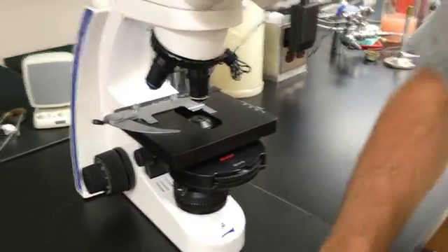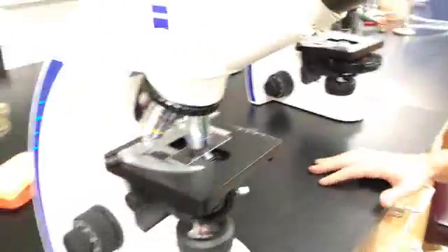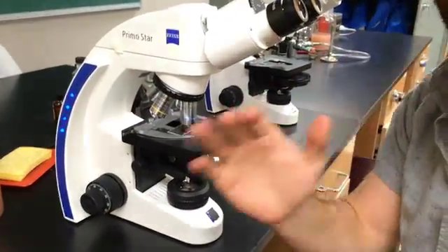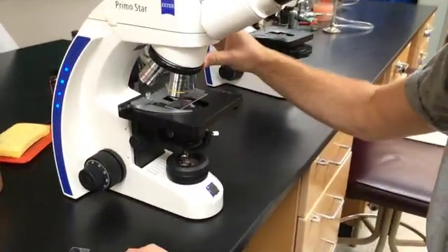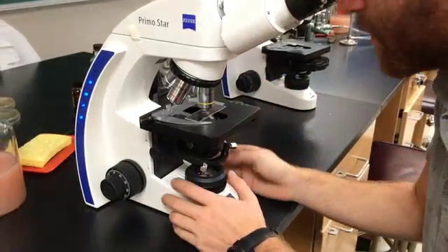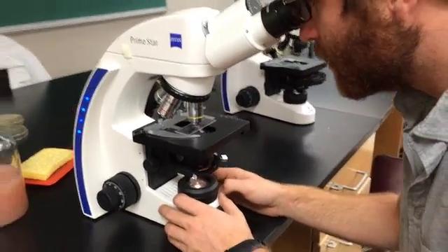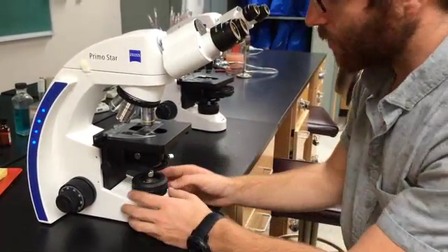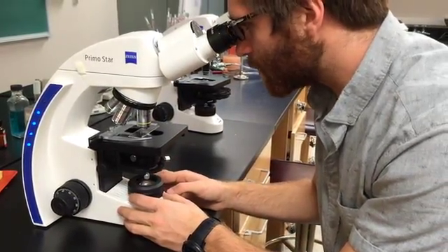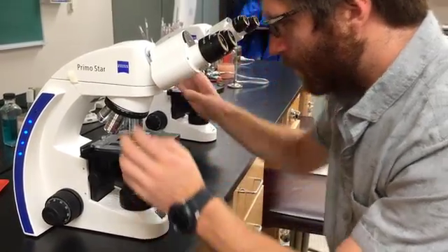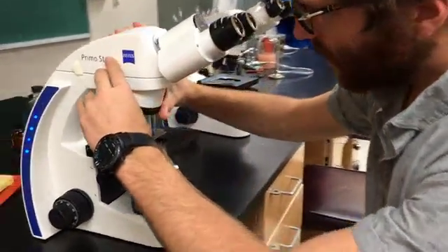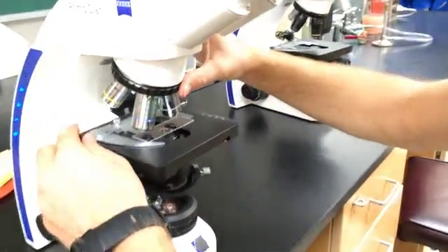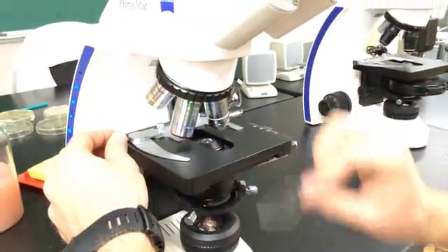So real quick, now that I'm all adjusted, let me just show you real quick. I told you for the exam I want to see that decagon at the 10x touching the outside, the corners touching the outside field of view. So I still got that because I aligned it earlier. I'm going to go to 40x, everything's in alignment. I'm going to move my objective out of place, pull out my slide.